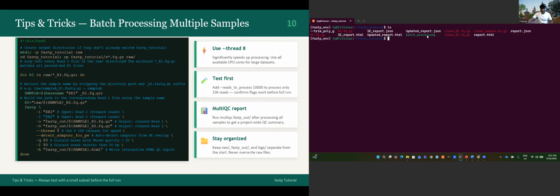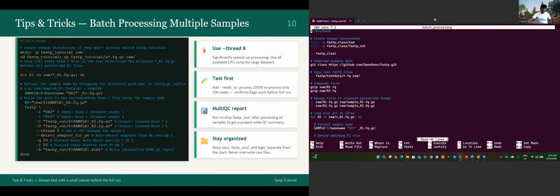That is batch processing.sh. Let's open it. Nano batch processing. You will see it's almost the same because I'm working in the same directory. I decided in the script to make another directory to not override the directory that I have already created. It will make a directory named fastp class and a directory named raw data for the raw data. It will also make another directory named fastp output.